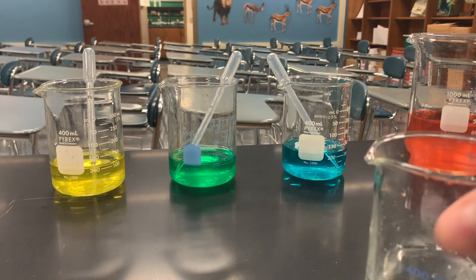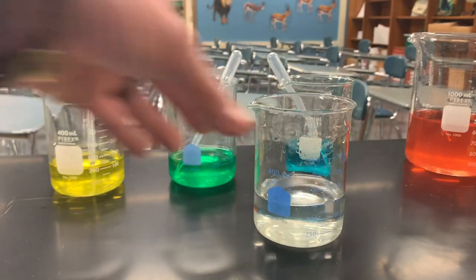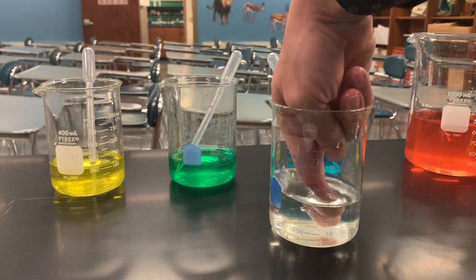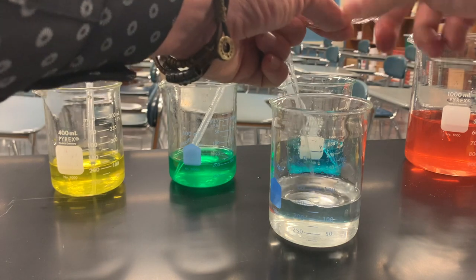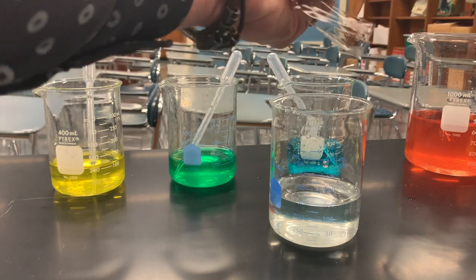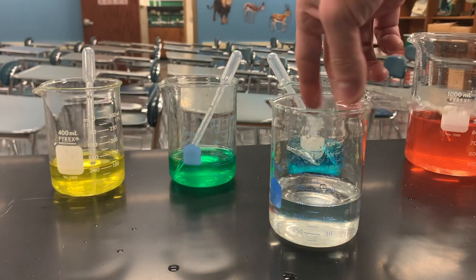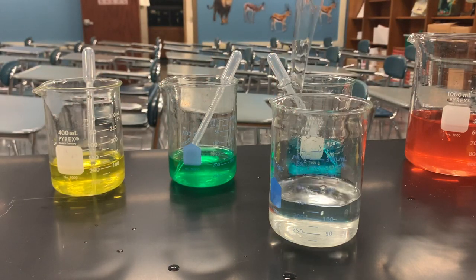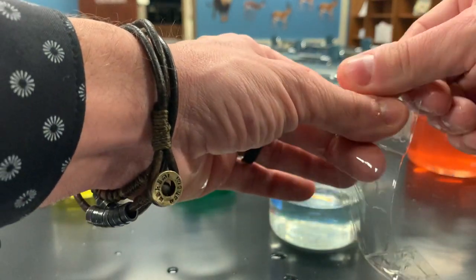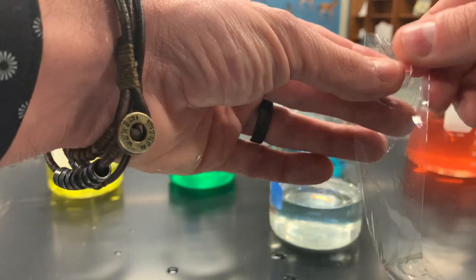Our first step is to get the dialysis tubing set up. I'm going to use some water to get it ready — first just dip the whole thing in the water. Now it is a tube, open at both ends. What I'm going to do is tie the first end off: make a circle, put the end through the circle, and pull it through to make a nice tight knot.